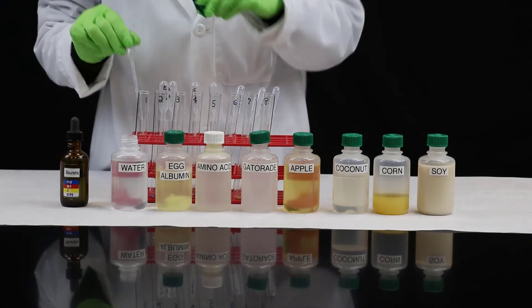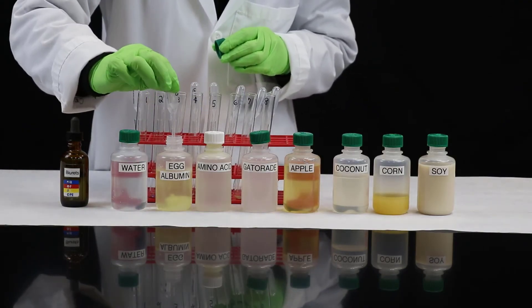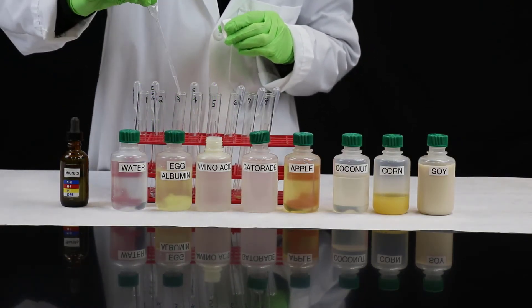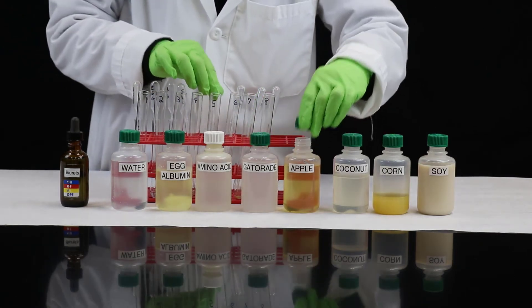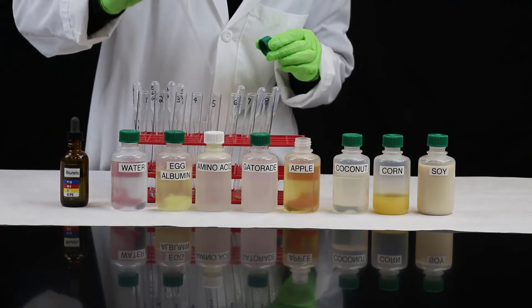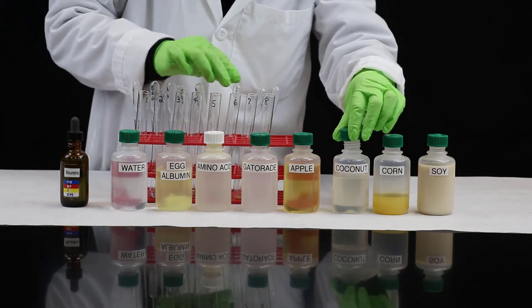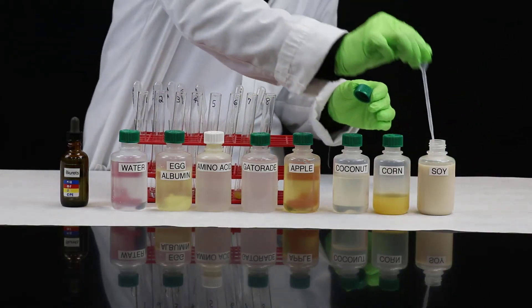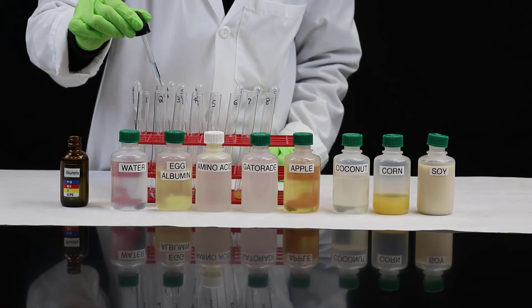Add a full dropper of each solution to the appropriate test tube. Now add half a dropper of Biuret solution to each test tube and shake well.